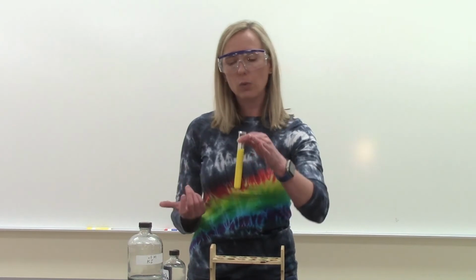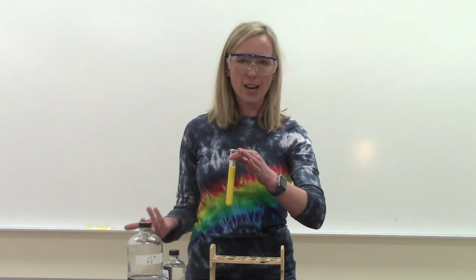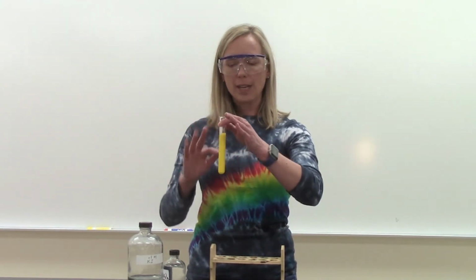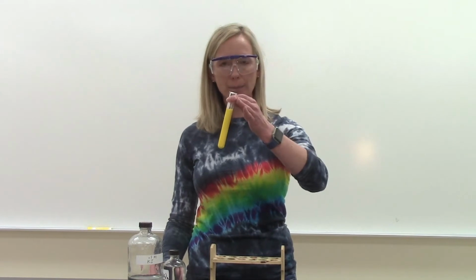It's a little bit like the consistency of chalk dust. And what's interesting is that if I let this sit here over time, the precipitate will start to fall to the bottom of the test tube. And if you think about the name, precipitate sounds a lot like precipitation, snow, rain, anything that falls from the sky and lands on the ground. Well, think about the word precipitate. You've got this chalk dust-like solid that formed, and it's going to fall to the bottom of the test tube, and I can actually see a lot of it starting to just build up on the bottom.